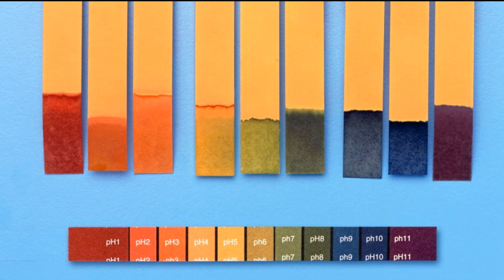We had hoped to track the pH change with the universal indicator. But the only really clear numbers are pH 1, a strong acid, and pH 6 or 7, neutral.